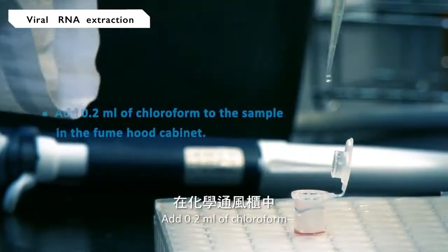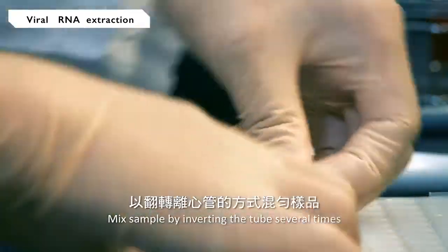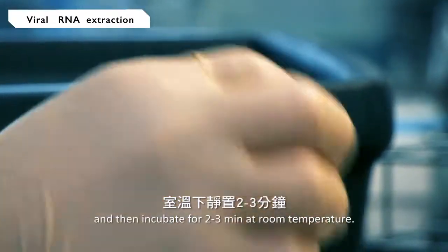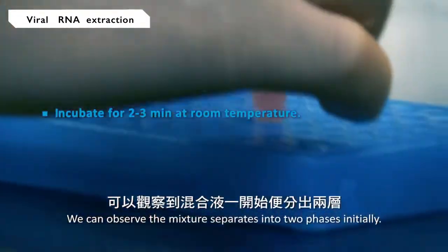Add 0.2 milliliter of chloroform to the sample in the fume hood cabinet. Mix the sample by inverting the tube several times, and then incubate for 2 to 3 minutes at room temperature. We can observe the mixture separates into two phases initially.